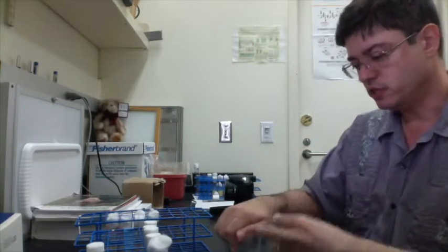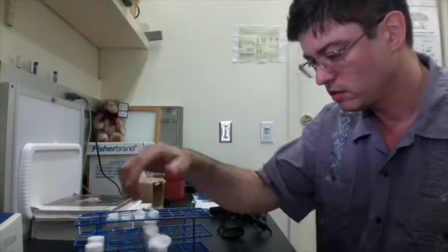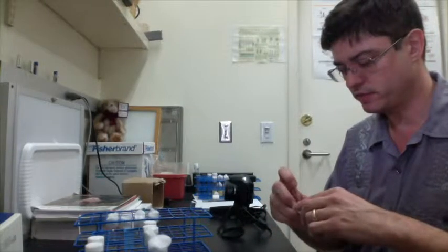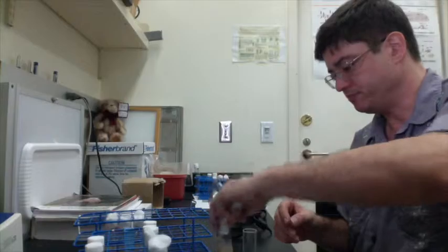Now, I would usually start with equal numbers of flies, and in this case, these vials were not prepared specifically for this video, so the numbers of flies are going to be slightly different. Another thing that you really want to be careful with when doing these experiments is glare, because if there is a reflection in the tubes, that reflection can throw off the analysis.